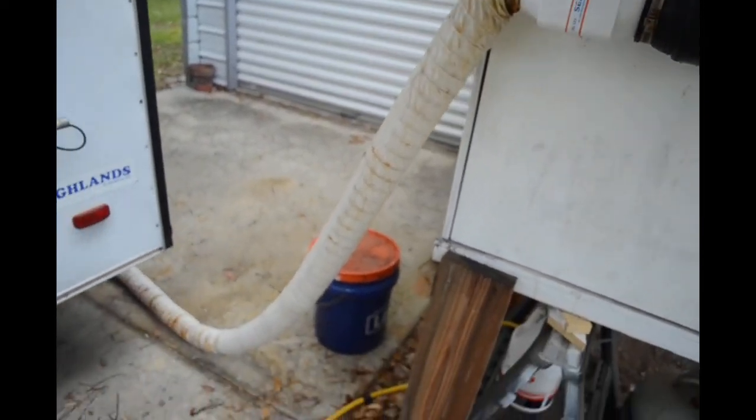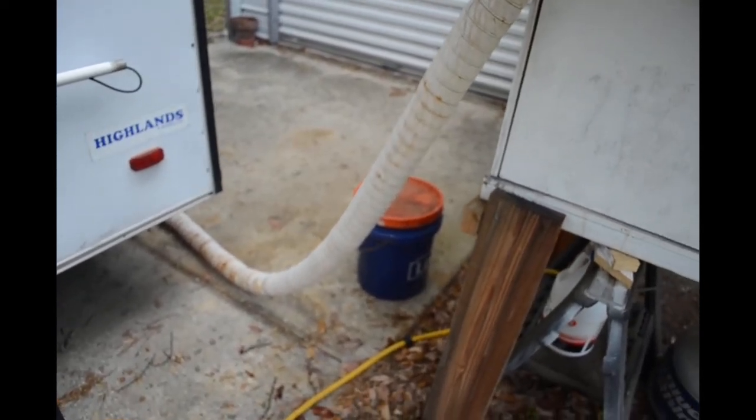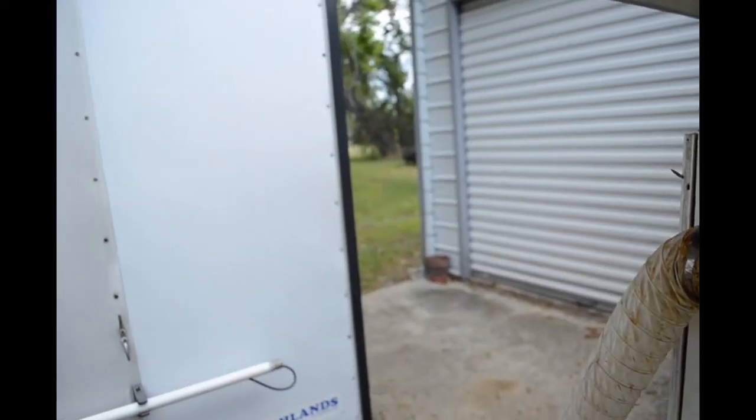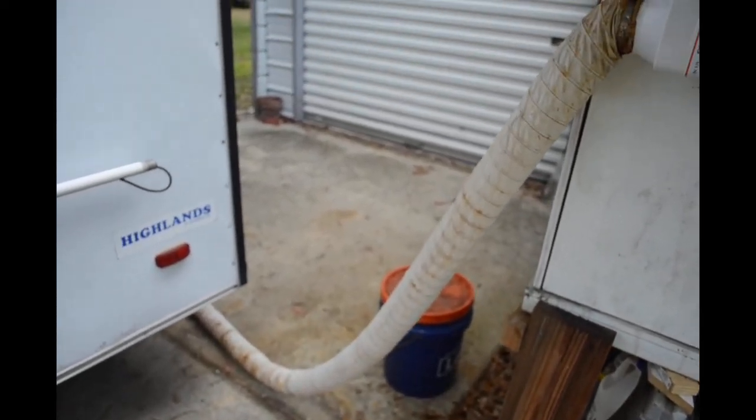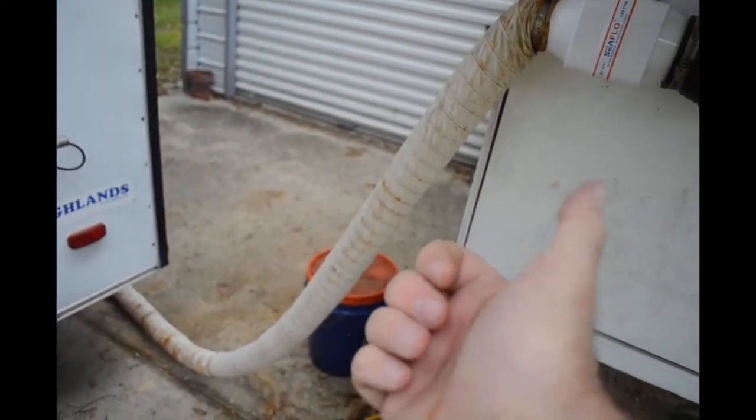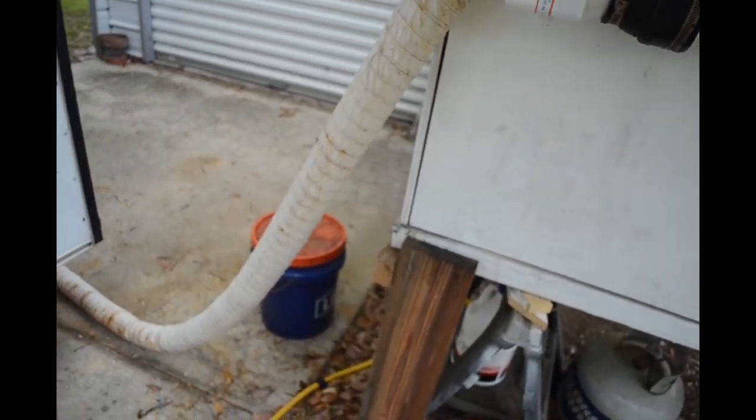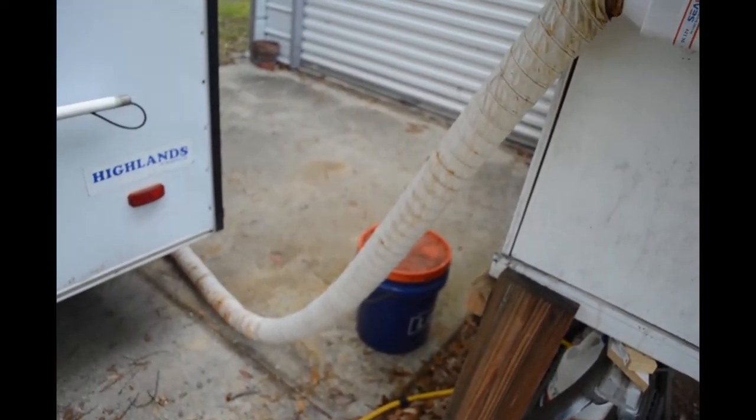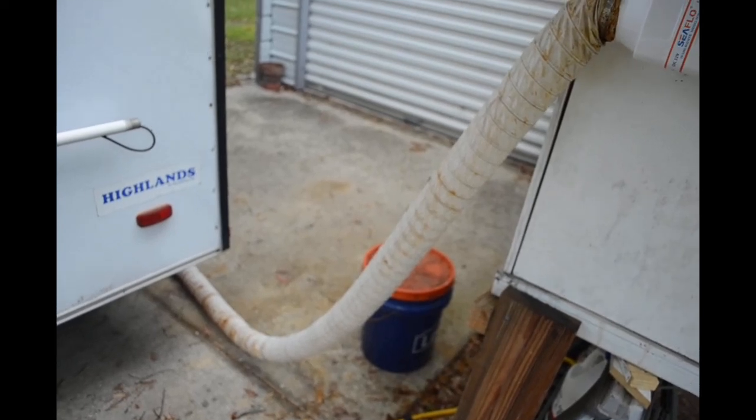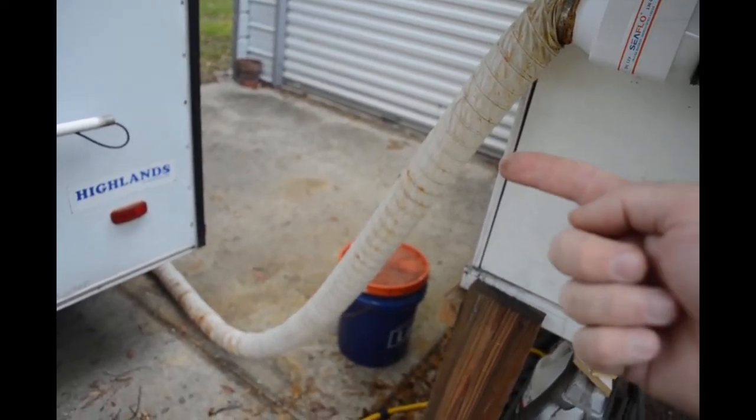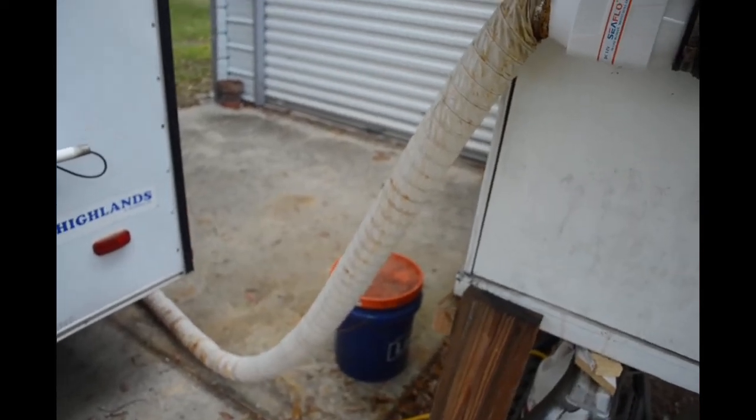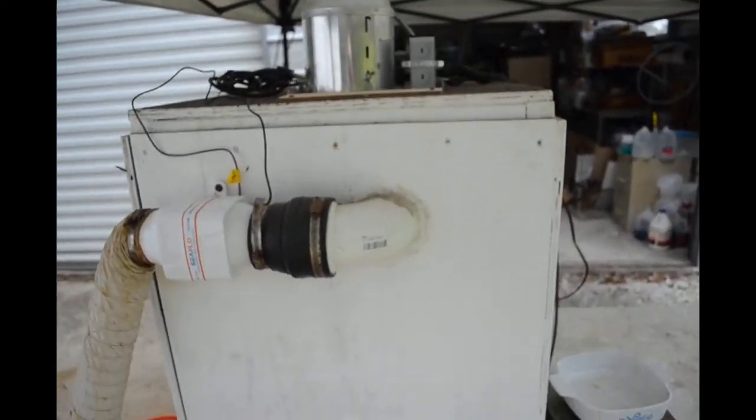Another thing I did wrong up front was I used aluminum vent tubing and that lasted maybe two weeks before it was all rotted out. But this plastic hose with steel hoops in it is probably two years old now. I have a new length of hose and once this starts leaking really bad I'll replace it. This is a long hose, about 30 to 40 feet long, and I run it out into the field.